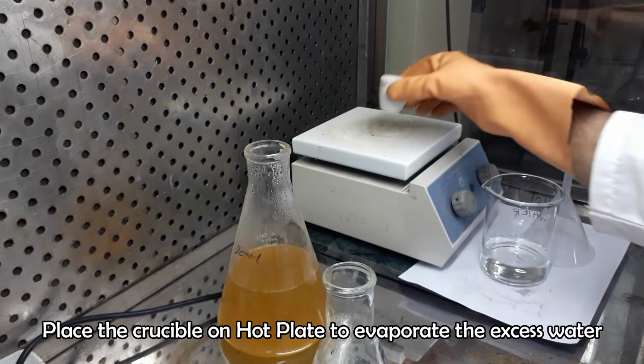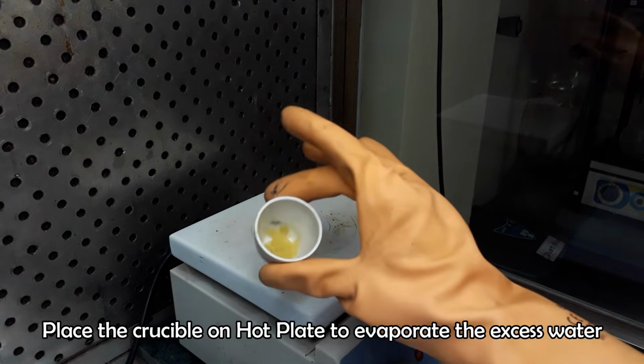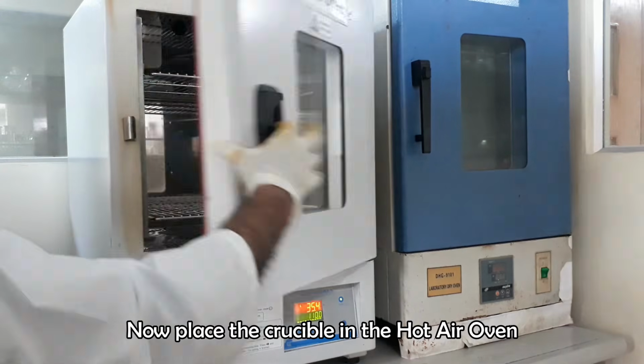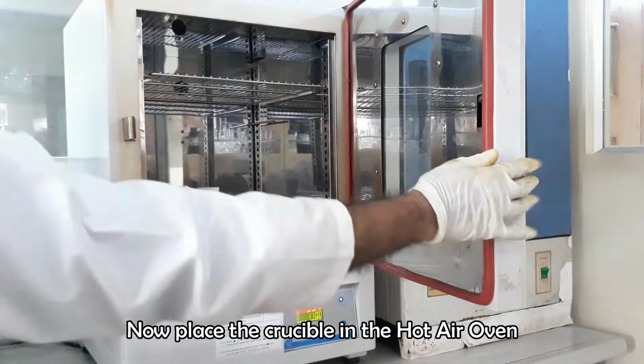Place the crucible on hot plate to remove the excess water from it. Now the collected fiber is dried in hot air oven at 130 degrees Celsius for 2 hours.